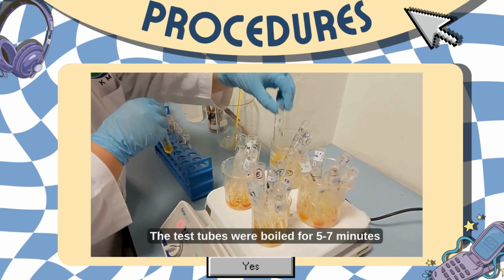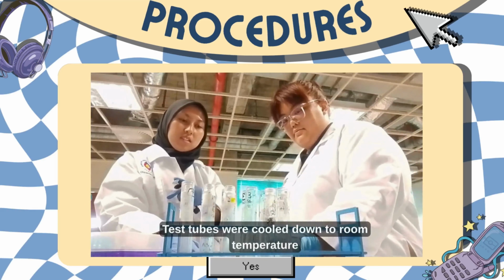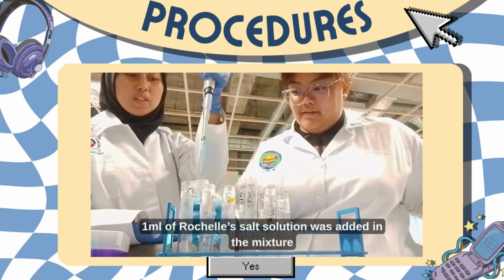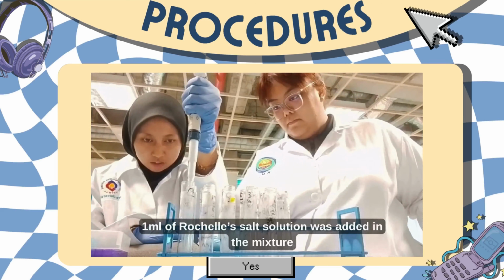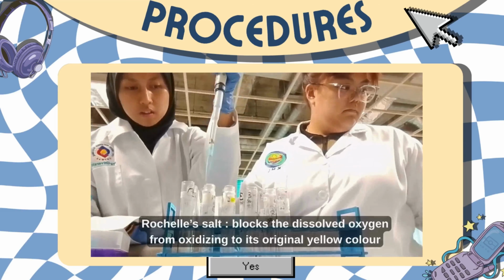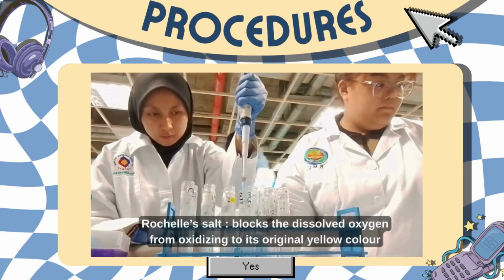The test tube is then boiled for 5 to 7 minutes. The test tubes were cooled down to room temperature before adding the Rochelle salt solution. Then, 1 ml of Rochelle salt solution was added in the mixture. Rochelle salt solution functions in blocking the dissolved oxygen from oxidizing to its original yellow color. This is important for the absorbance reading later.